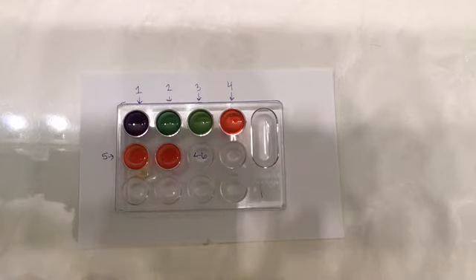And samples four, five, and six, they're all, what color would you say? Red orange. I would agree with you on that, Mr. Scientist George. So take a moment now and to fill out the column in your chart titled color after testing.